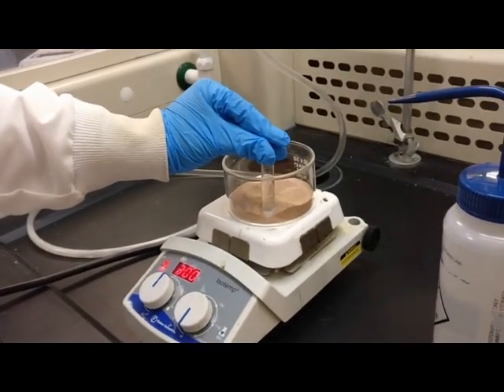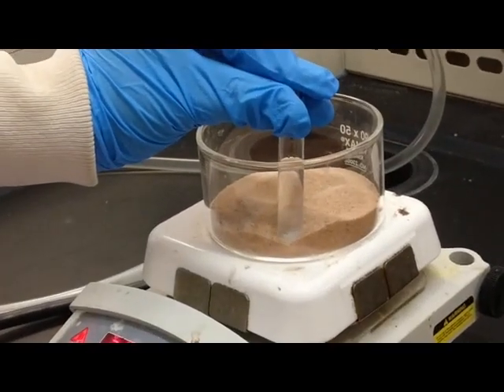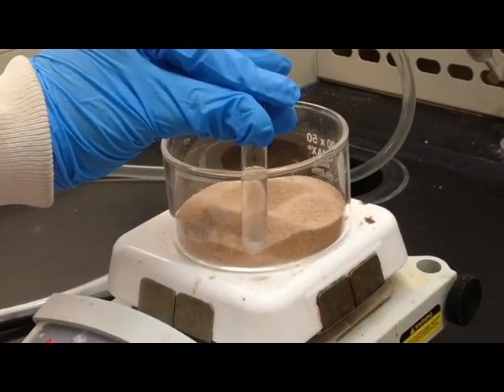As you can see, for this example, when you heat it, the solid dissolves. And so this is the one we'll further use.